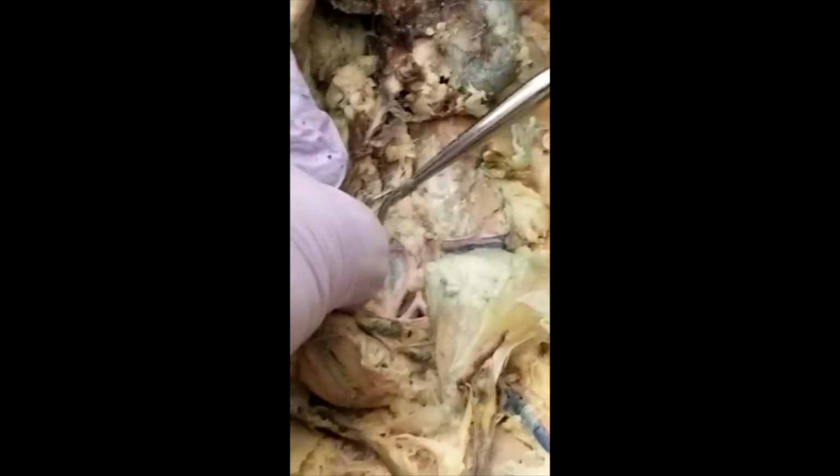So after that, you get the iliolumbar. So that's iliolumbar, left and right. This one is exactly the same location. In some of the cats, this one is upper, this one is a little bit lower. And then you get external iliac, internal iliac, and the caudal in the middle. The caudal. All right. So that's all the arteries in the abdominal cavity.